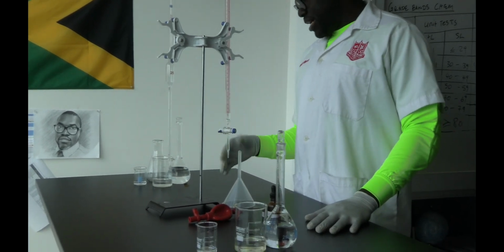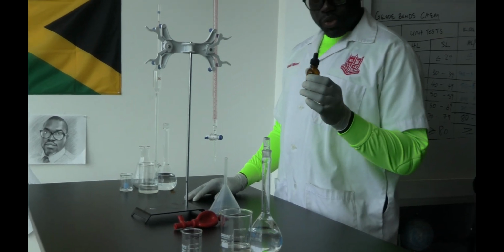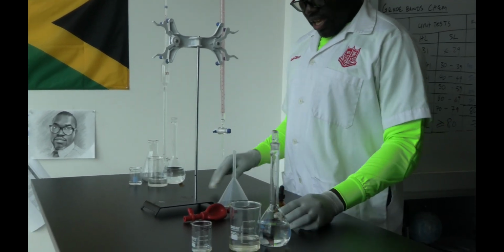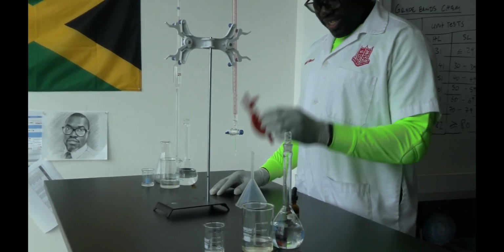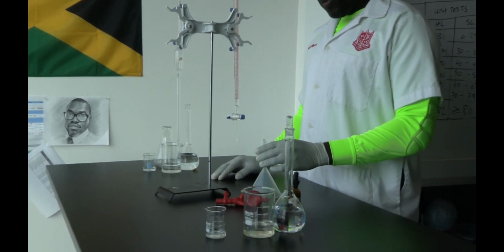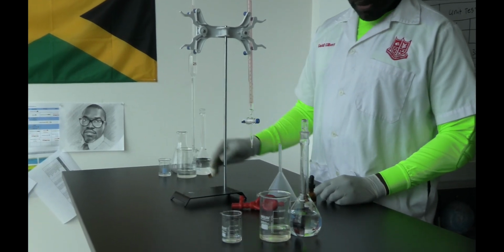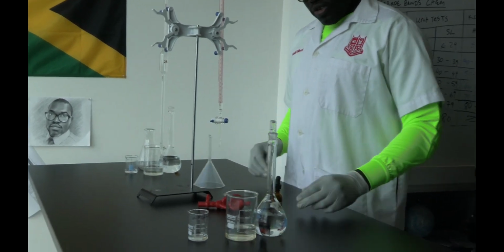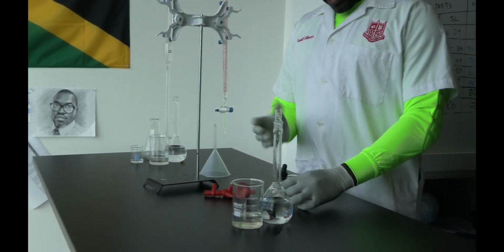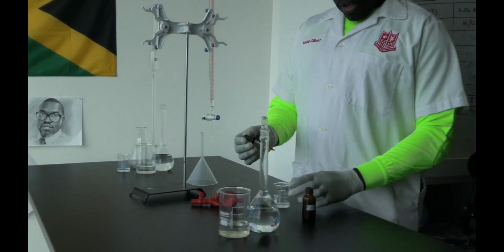So I have all my apparatus here, I believe. I have my methyl orange, which will be my indicator, my pipette filler. When I was going to school, we didn't have these things. A filter funnel, your burette, your clamp stand, your pipette, 25 ml pipette, and of course we had our solutions previously. So what I'm going to do first is just check the color of my indicator in acid, so I can know what my endpoint color change will be.